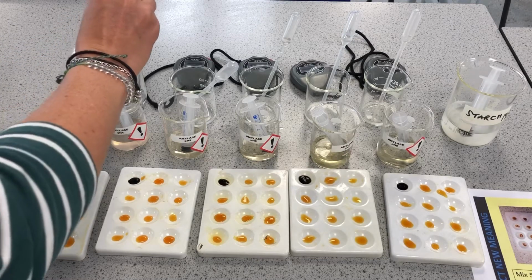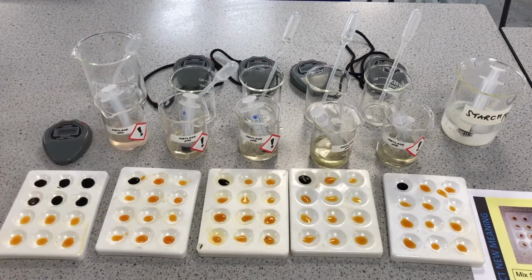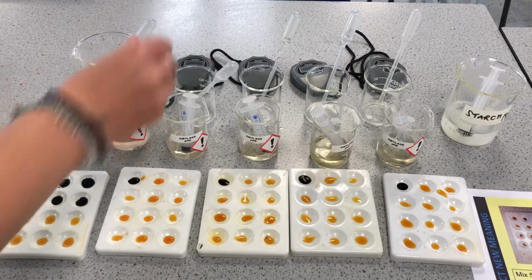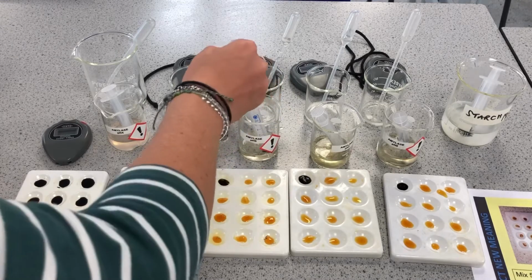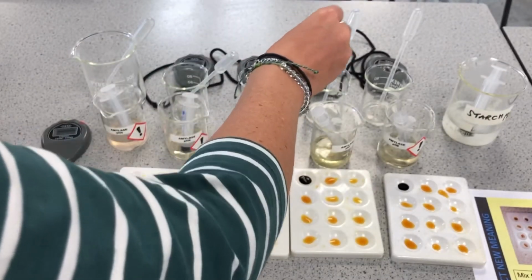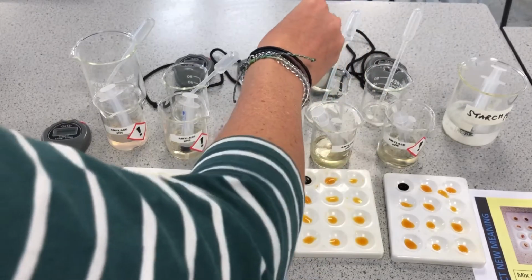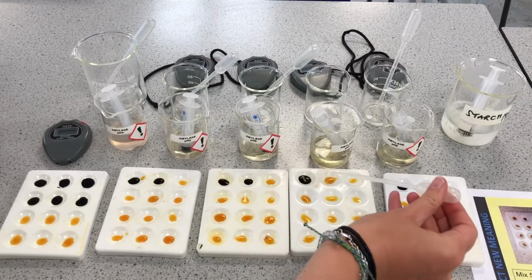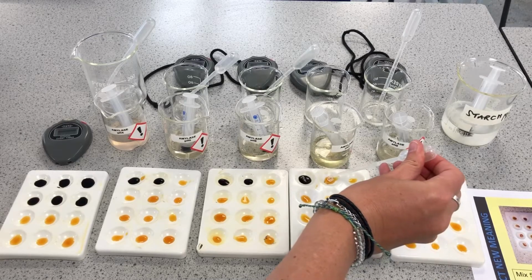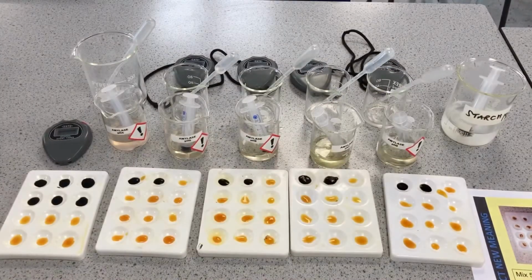So it's about time to do it now. So that's the pH 4, definitely more on the brown side, so that starch is definitely being broken down. pH 5, not there yet. pH 6, looking surprisingly good actually, quite brown. Still not anywhere near being done yet, but we'll keep going. pH 7, okay, that's also breaking down the starch, and pH 8, which isn't looking too good at all. Okay.